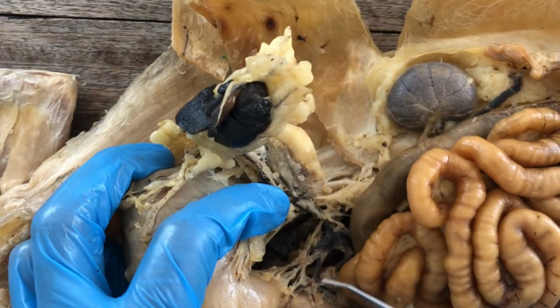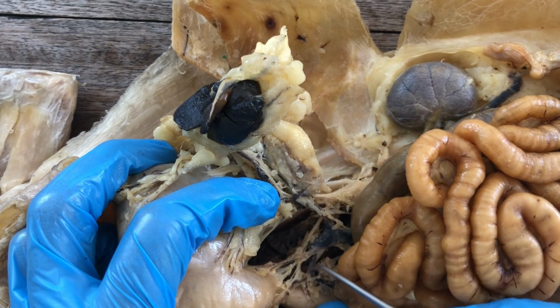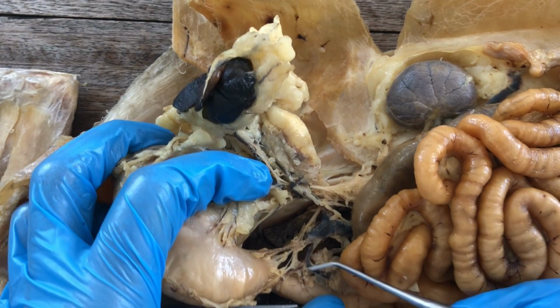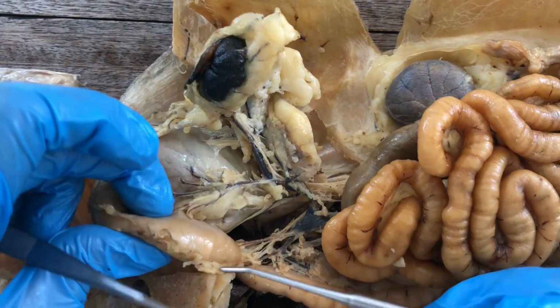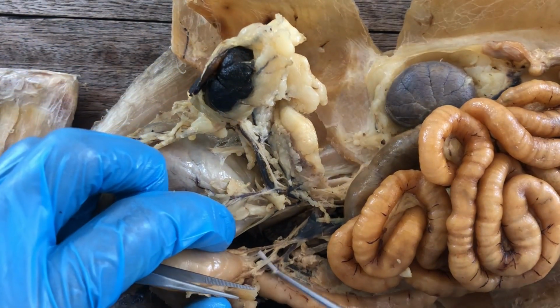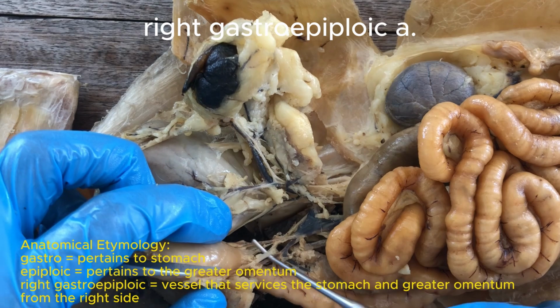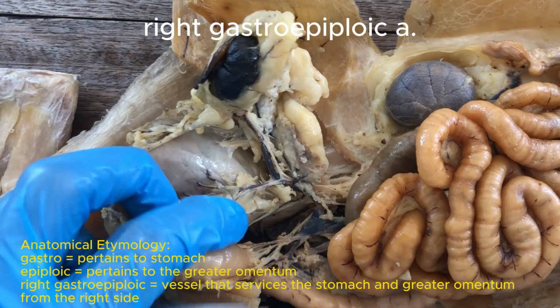And then if you look on the back side, this is still the gastroduodenal artery, and it has a branch going to the greater curvature of the stomach. That would be the right gastroepiploic artery.